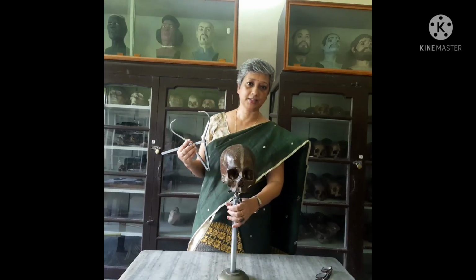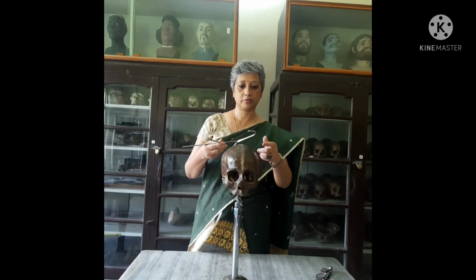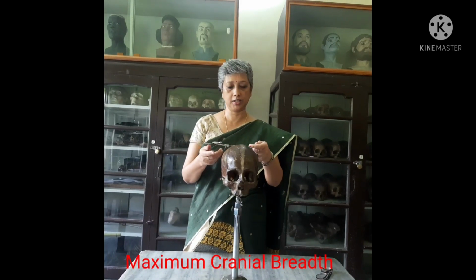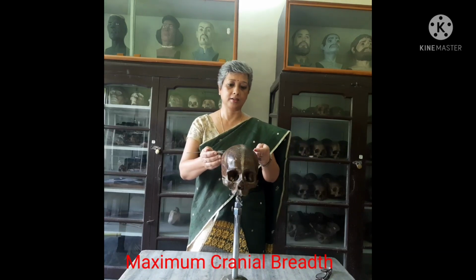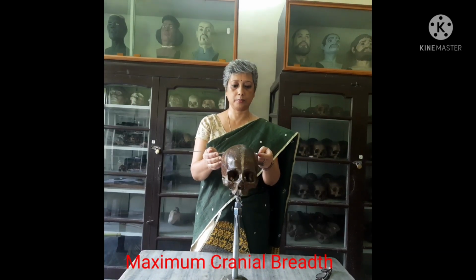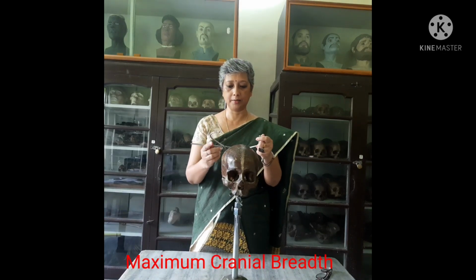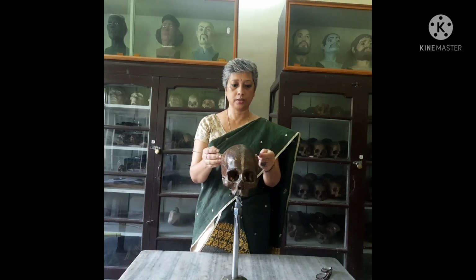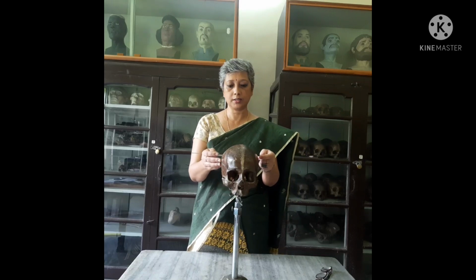Next we will be taking a breadth measurement. For this we will be demonstrating the maximum cranial breadth, which is taken as a transverse distance from the mid-sagittal plane. We use the spreading caliper, and the maximum cranial breadth is taken from eurion to eurion. The eurion is the lateral-most point on the lateral walls of the cranium.